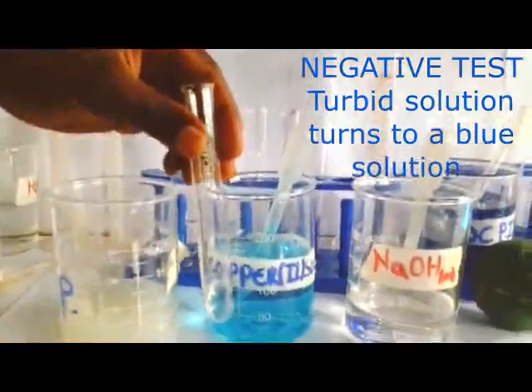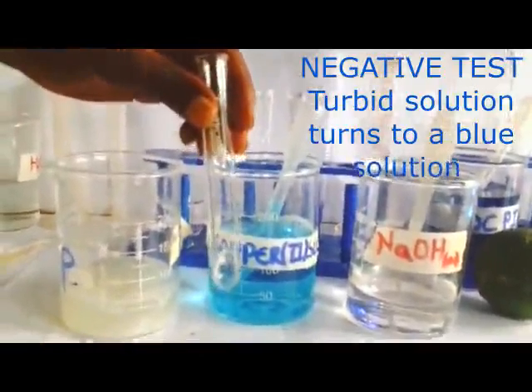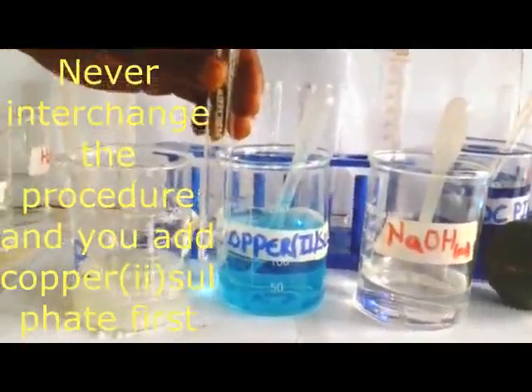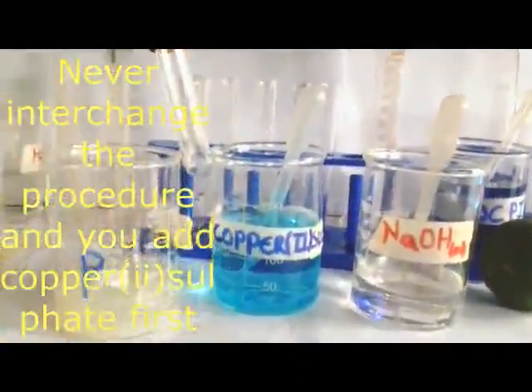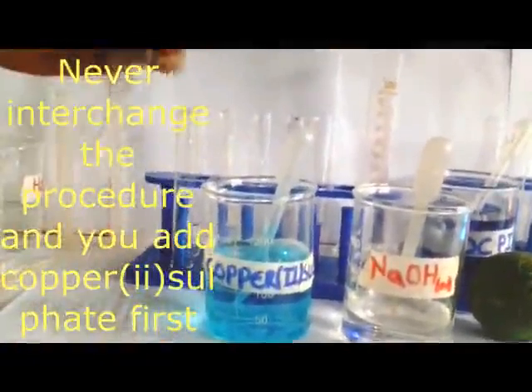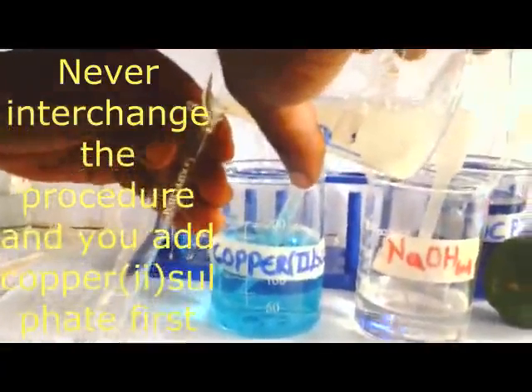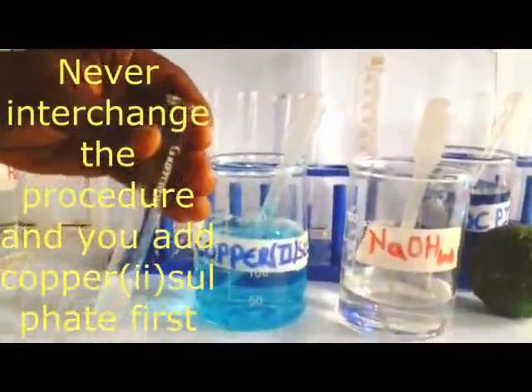Members, take note of the procedure properly. It is sodium hydroxide first, then drops of copper 2 sulfate next. If you interchange, you are going to obtain opposite results. Let us try it. So let me get my solution P, which gave us this one. Don't forget. Now let me put it in my test tube, that same solution P, the one with the proteins.